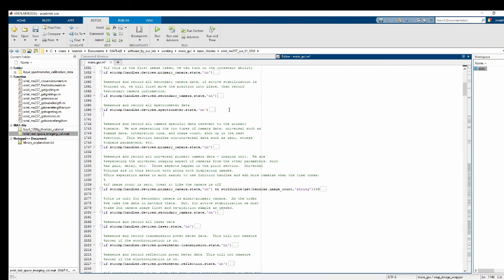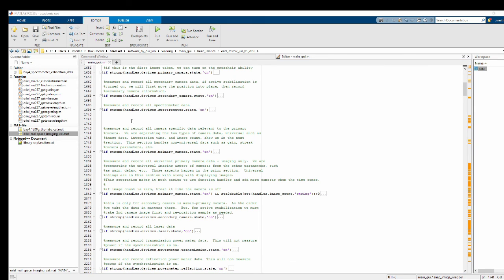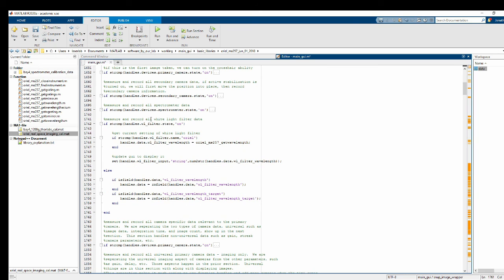Here's the spectrometer. So let's go ahead and I'll copy this code that I already wrote. Measure and record all white light filter data. So if the filter's on, get the current wavelength and update what's displayed. And if it's not, remove the corresponding fields from our data structure. Now, something you might realize here is we're removing the white light filter wavelength target, which is what we tried to hit, the 650 we typed, and we're removing the actual wavelength value, maybe 649.9 or whatever it is. But we don't record both of them.